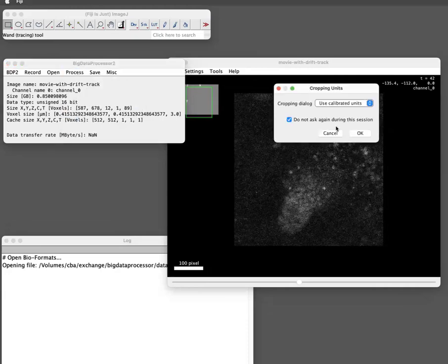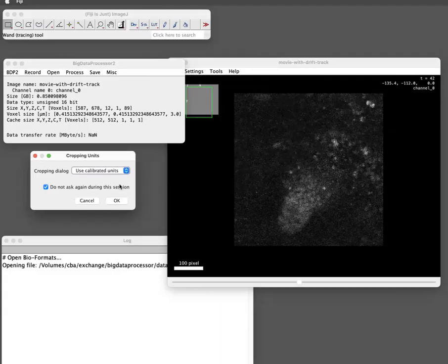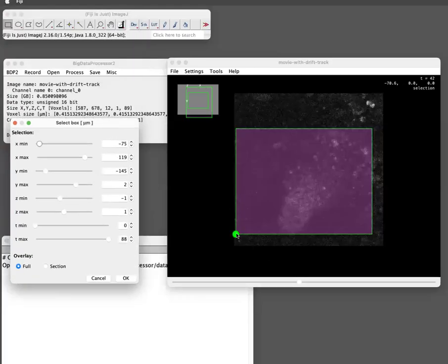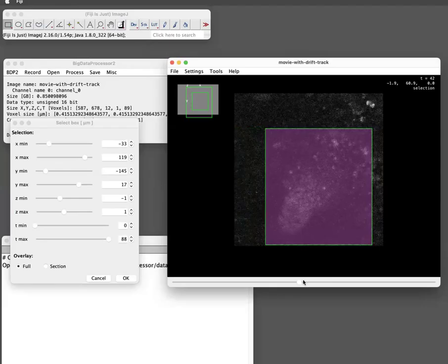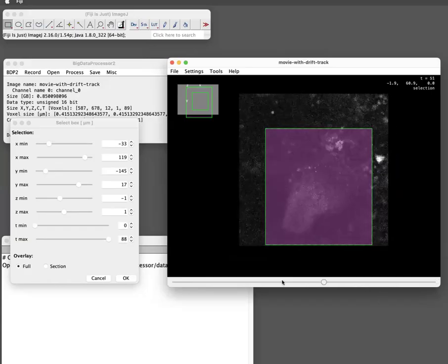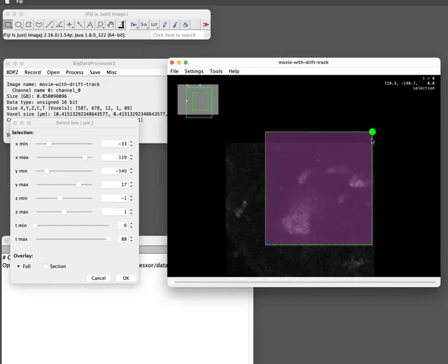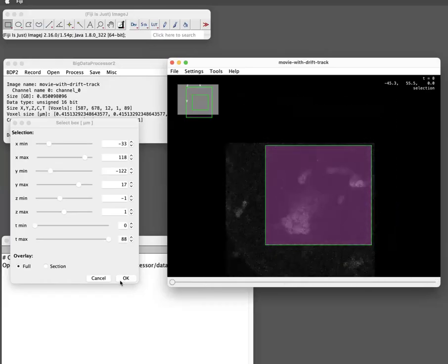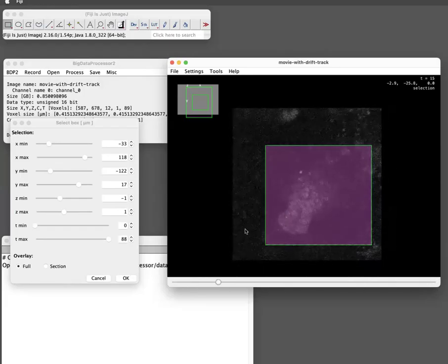So we will first crop. You can choose pixel units or calibrated units. Doesn't really matter here. Now we put a window such that in all frames our object of interest is present, and I would also do it such that there are no black pixels, but it depends what you want to do. So this is in XY. We also have to crop in Z. I think there, maybe we just take all planes now.